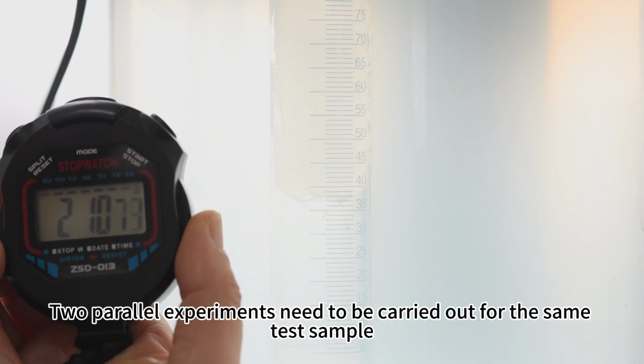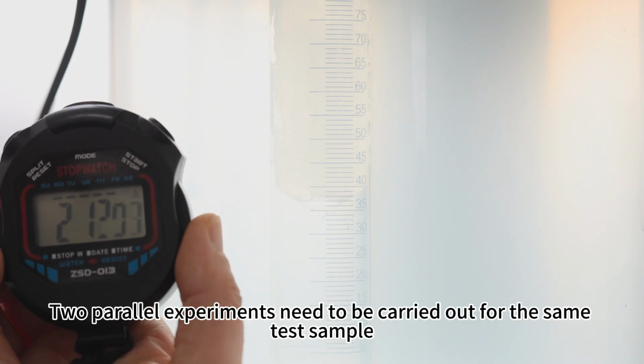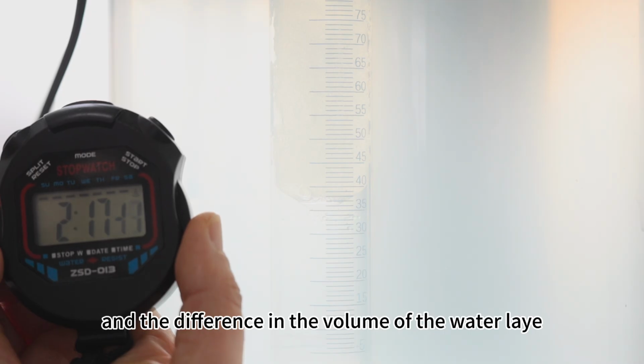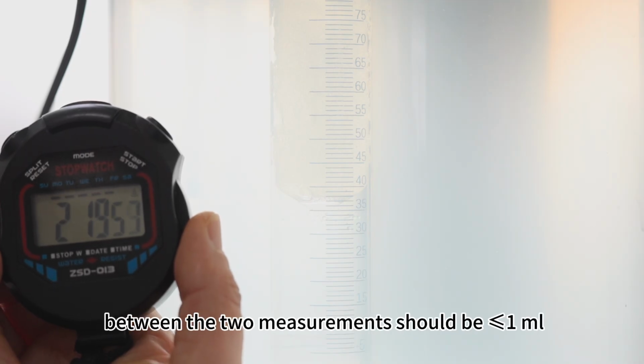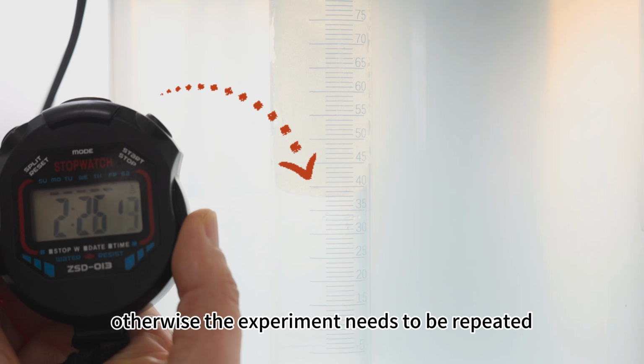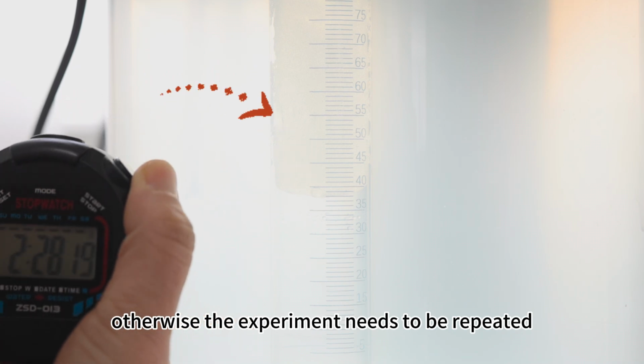Two parallel experiments need to be carried out for the same test sample, and the difference in the volume of the water layer between the two measurements should be less than or equal to 1 milliliter. Otherwise, the experiment needs to be repeated.